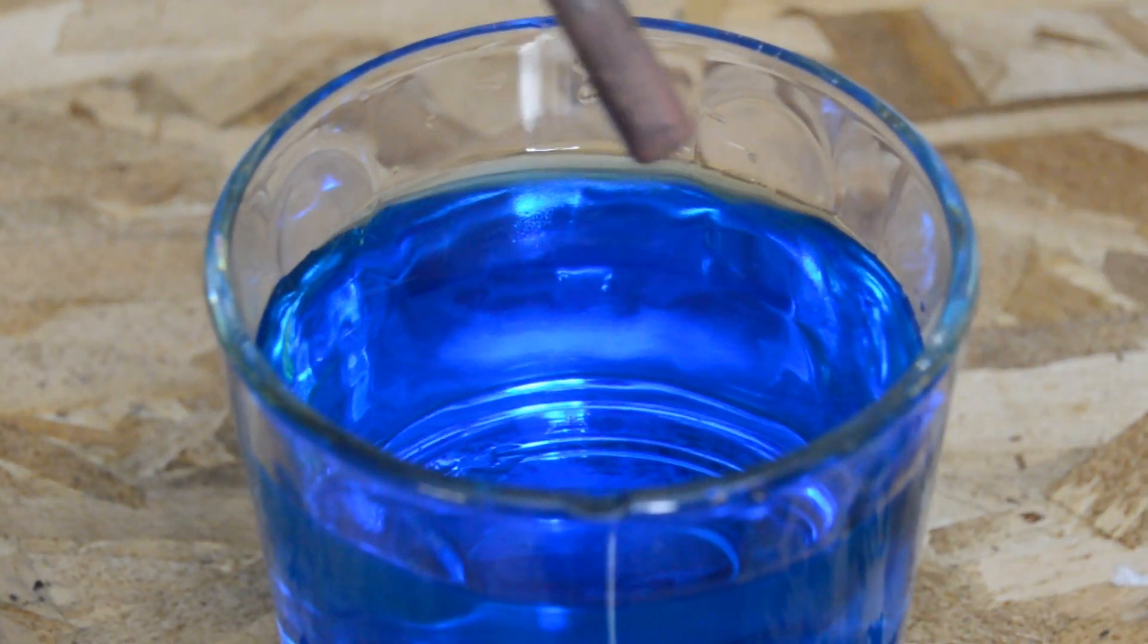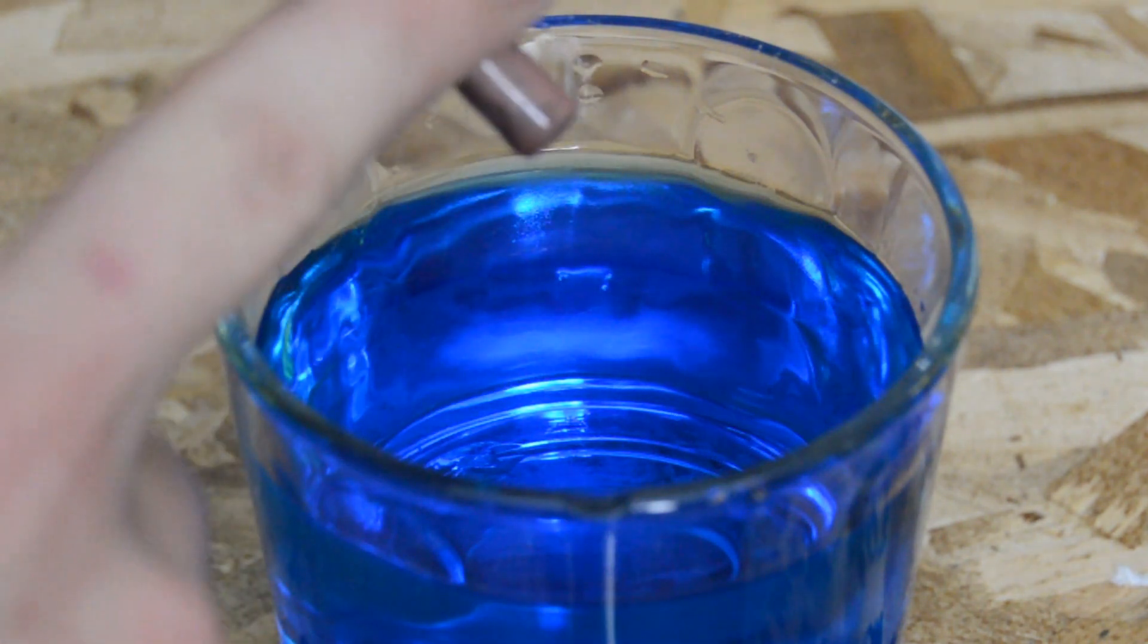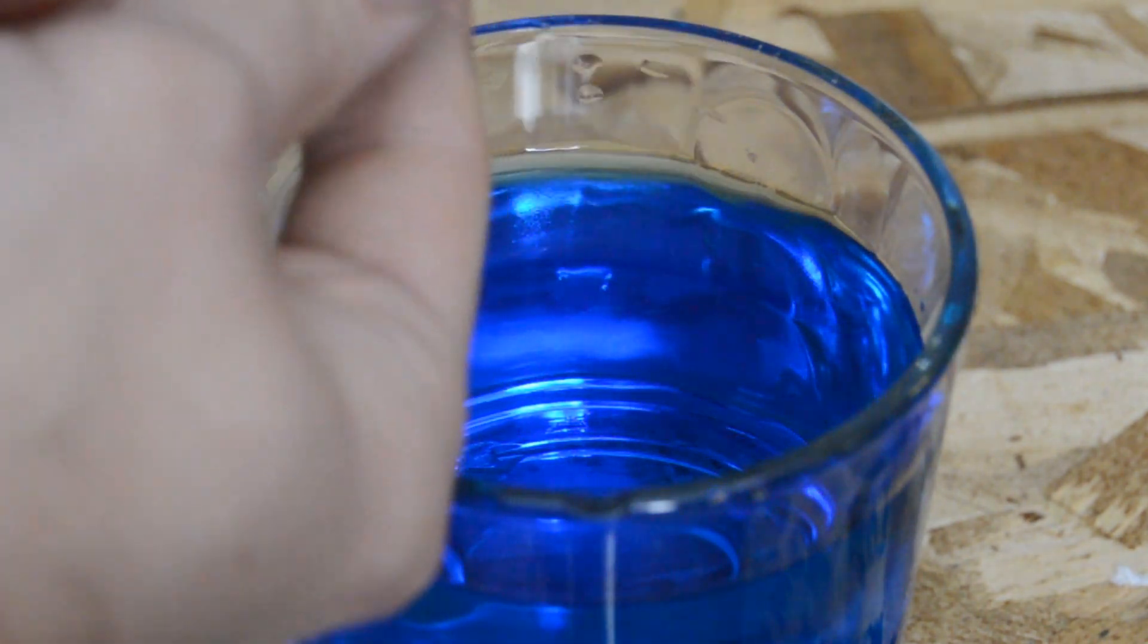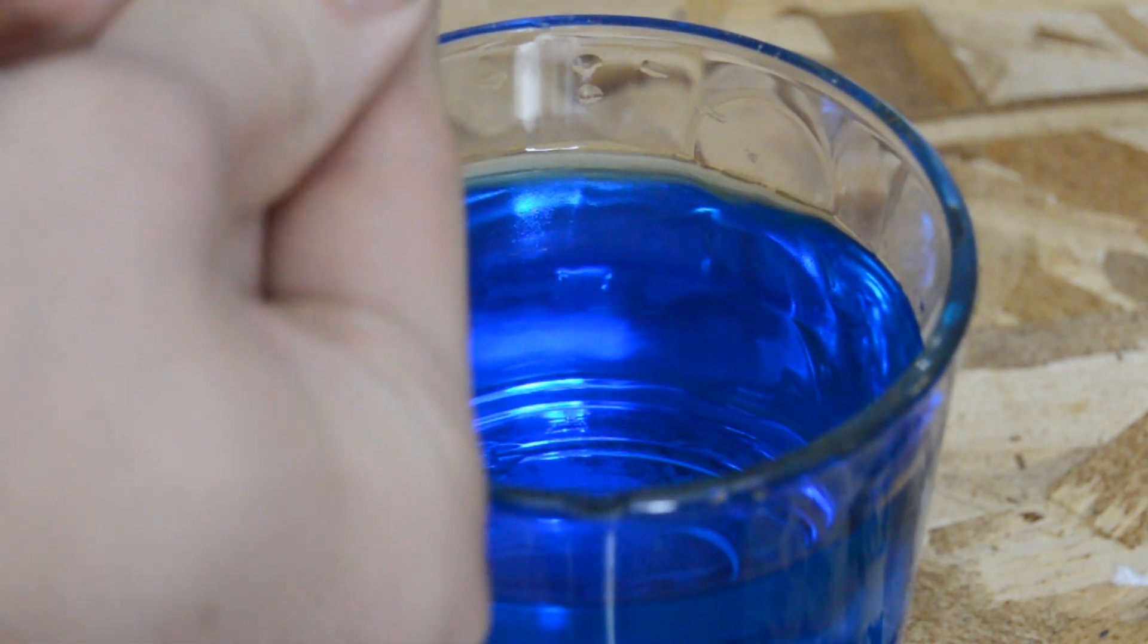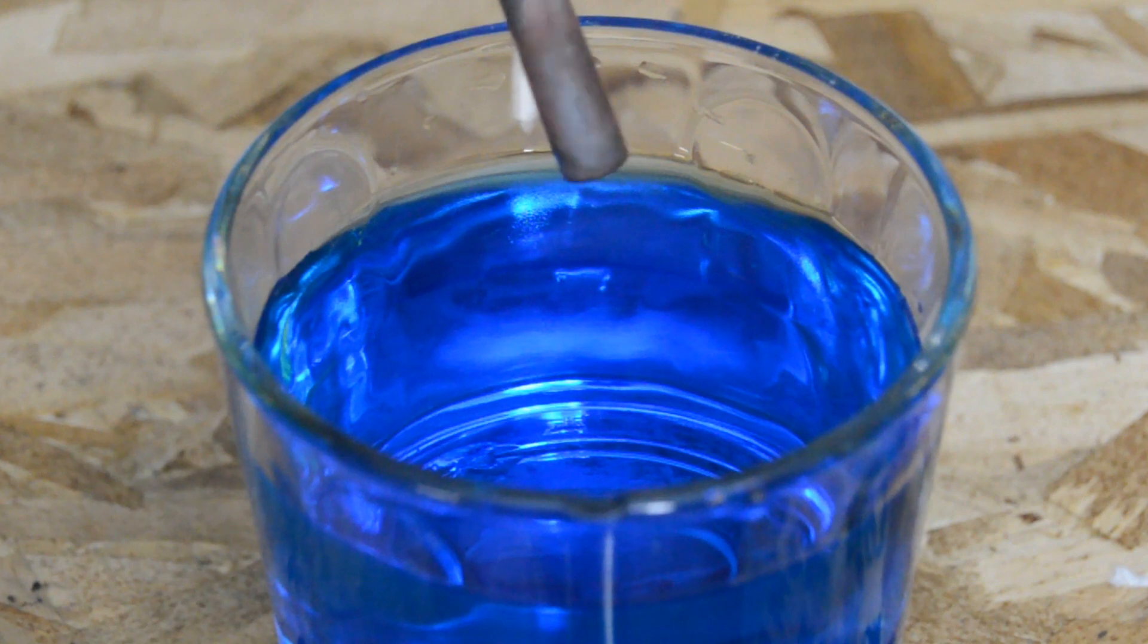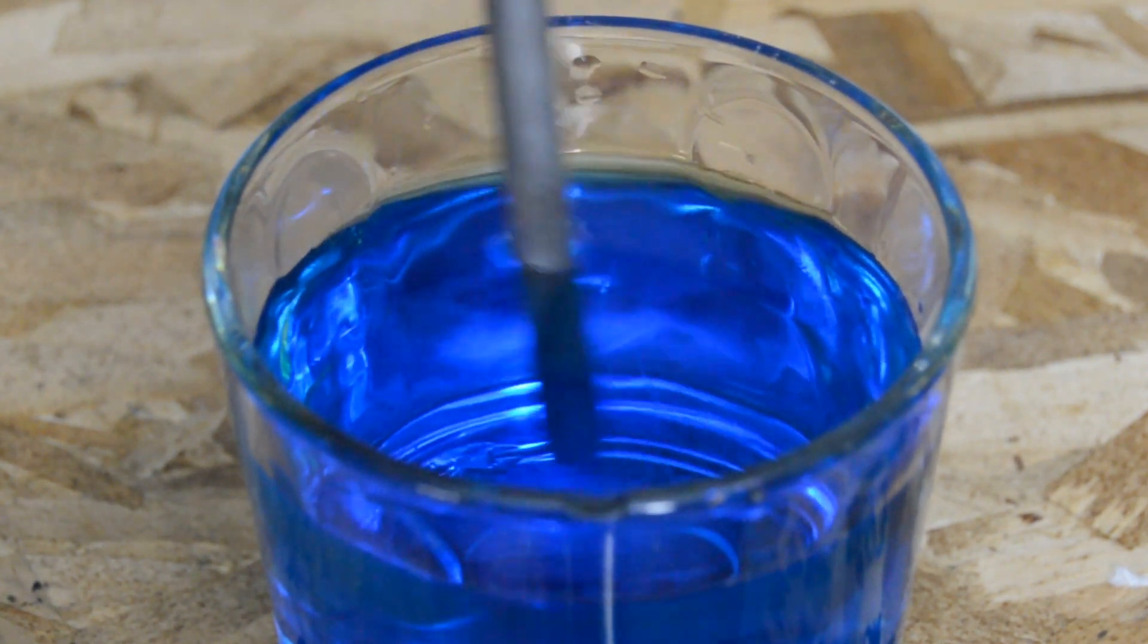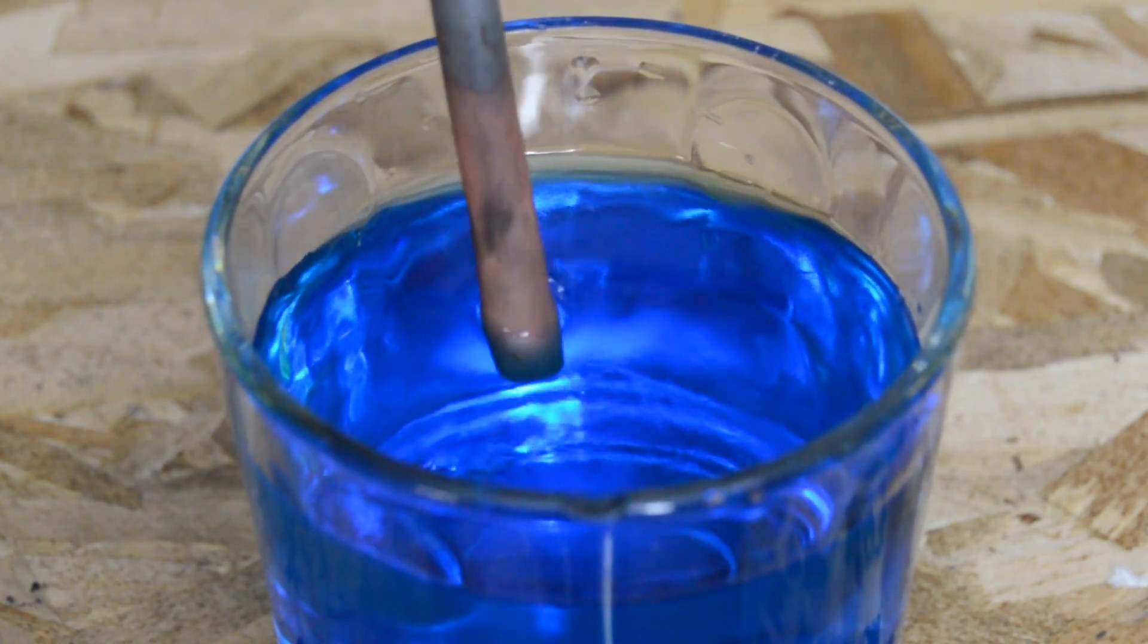It's important to realize that this is not copper plating. There is merely a coating of precipitated copper on the surface of the iron. Unfortunately, since copper isn't actually adhered to the surface, it is easily wiped off. This is why copper plating cannot be done directly to iron components. The nearly instant displacement reaction prevents any kind of adhesion during copper plating.